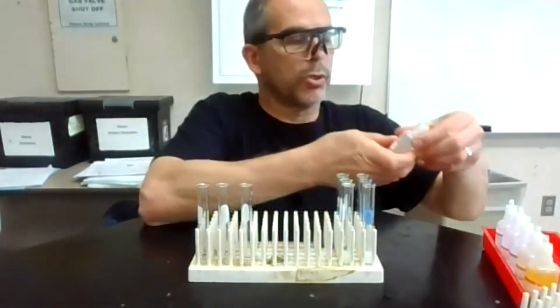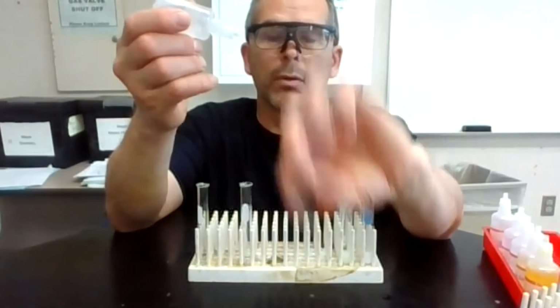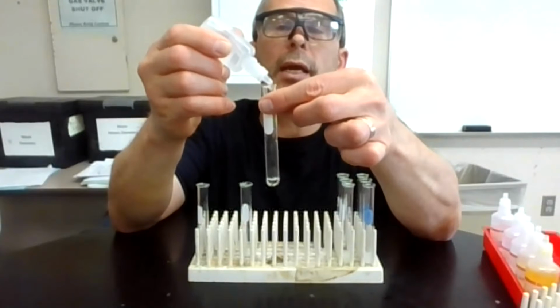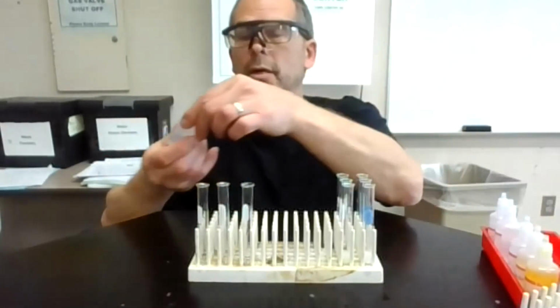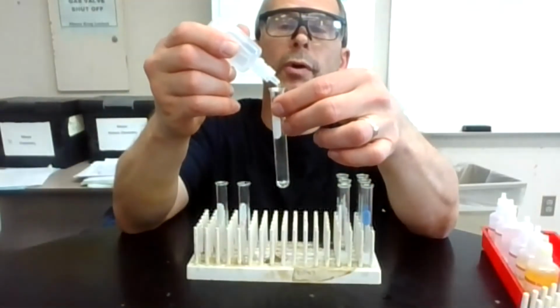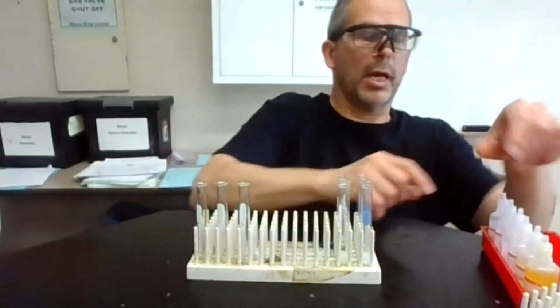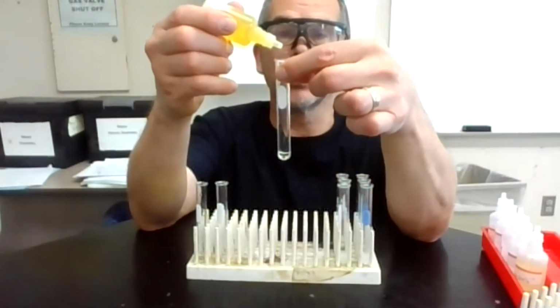Okay, now I'm going to go to my barium and extra water. 1, 2, 3, 4, 5, 6, 7, 8, 9, 10. And now I'm going to go to my zinc right here. And 1, 2, 3, 4, 5, 6, 7, 8, 9, 10. Okay, so I look at this, and then I'm going to add CrO4 minus 2. This is to the silver.